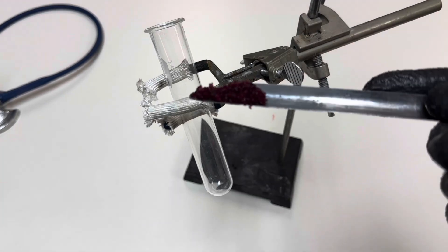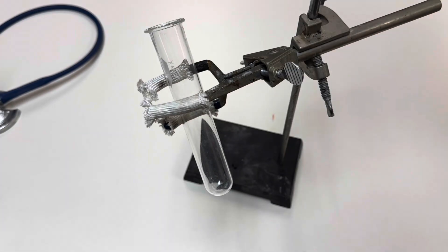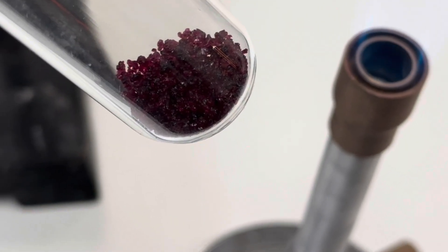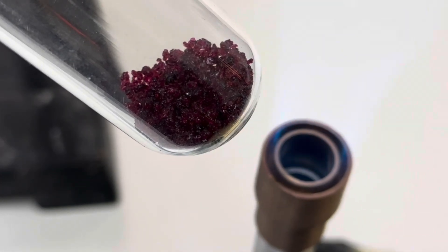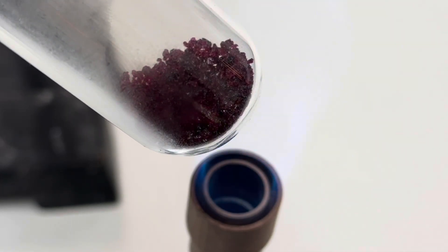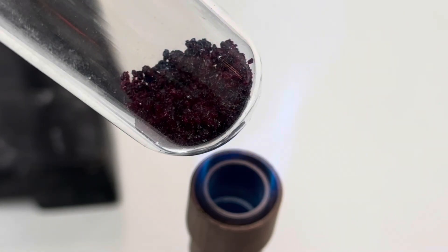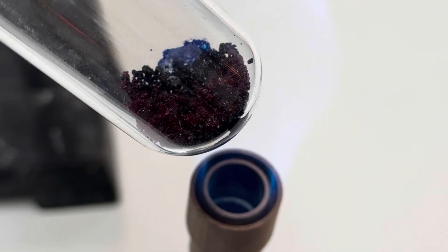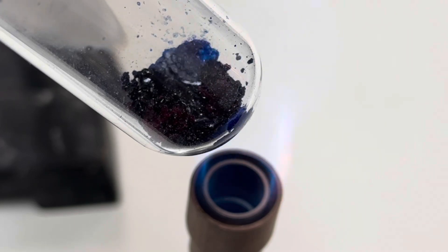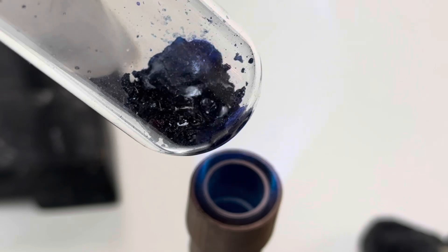Begin by adding one gram of cobalt-2-chloride hexahydrate. You'll see it has kind of a pink luster to it. Next, turn on your Bunsen burner and start heating the crystals. You'll notice a color change right away — you'll start to see the crystals turning from that pink color to a blue color.